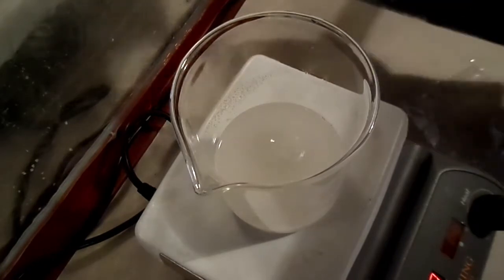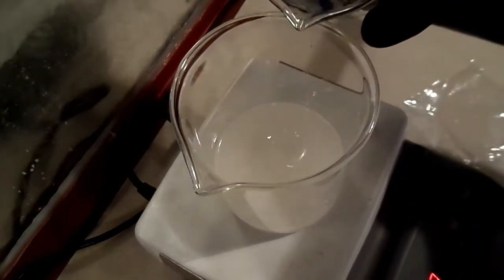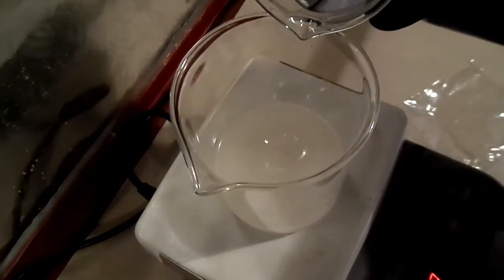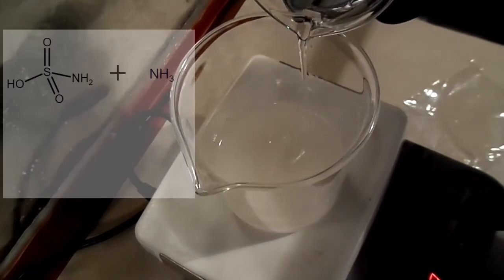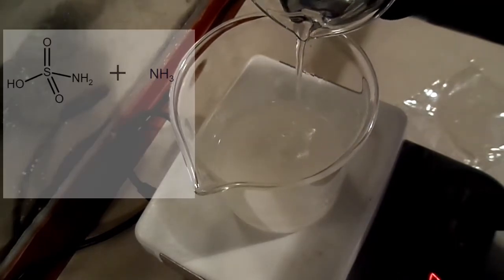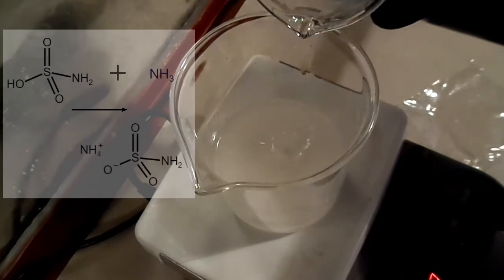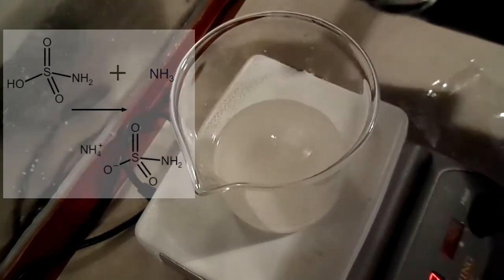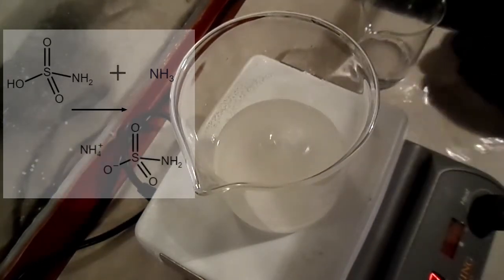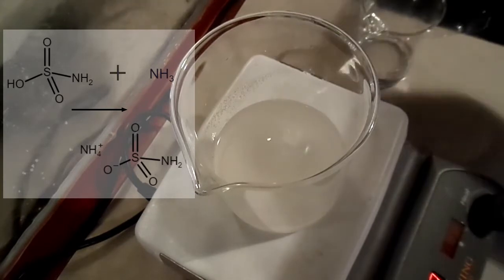Next, I slowly began the addition of the ammonia solution. The reaction between the ammonia and sulfamic acid is a simple acid-base reaction producing our desired product, ammonium sulfamate. I kept the beaker covered with some plastic wrap in an effort to prevent ammonia fumes from escaping.